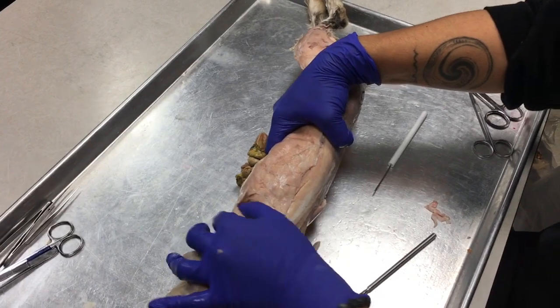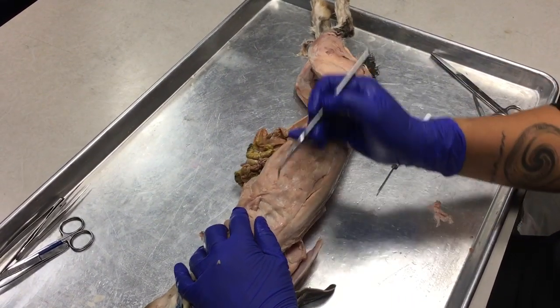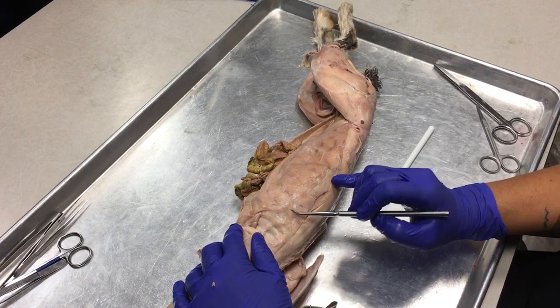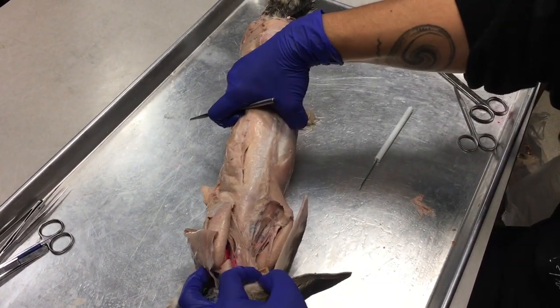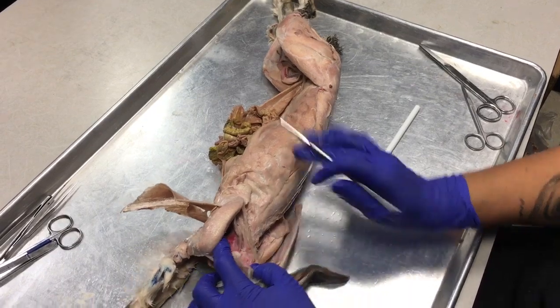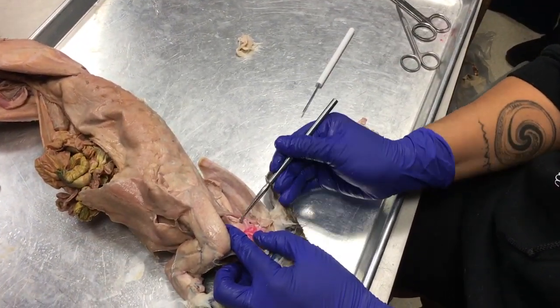Okay. If we look underneath our serratus dorsalis muscles, we see ribs here. You can see evidence of ribs. And the muscles in between those ribs are known as the intercostal muscles. And one thing I forgot was that if we look underneath the rhomboideus muscles here that are extending toward the neck region, you're going to find that there's a huge muscle covering the neck.